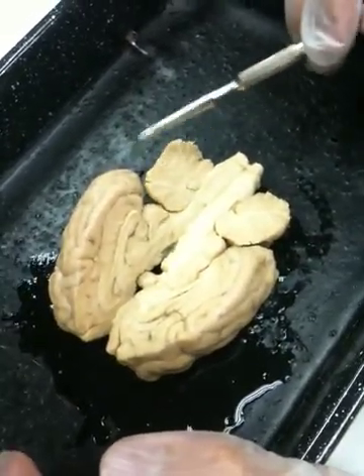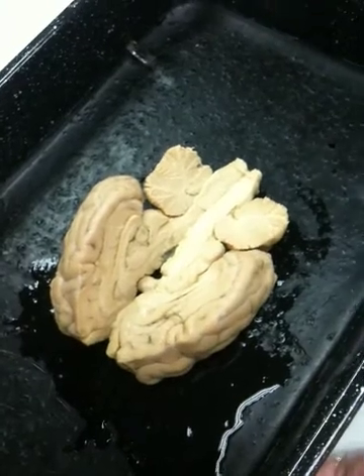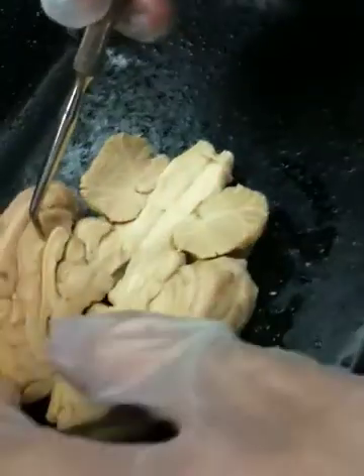This may be very difficult for me to show on the camera. We'll do the best we can. There are a couple of very tiny structures that you need to be able to locate. The first one is called the anterior commissure. It's right there on this sheep's brain. All it is, is a little teeny tiny small dot of white tissue.